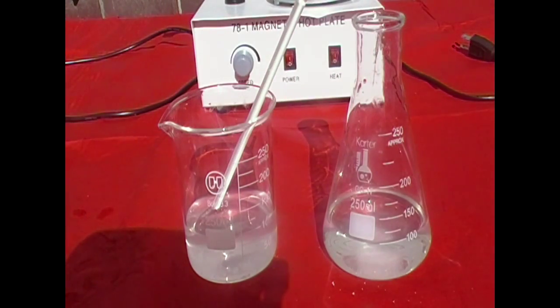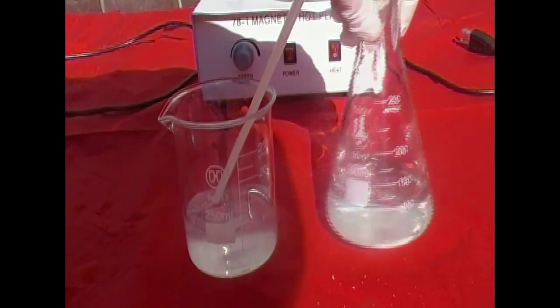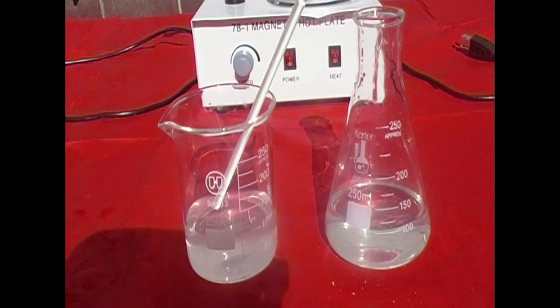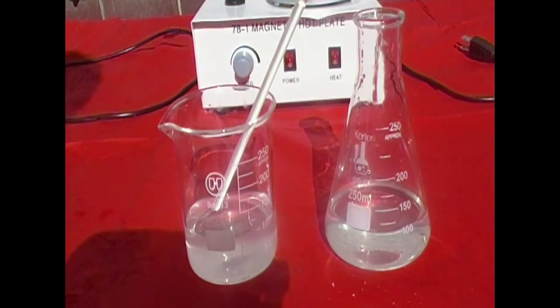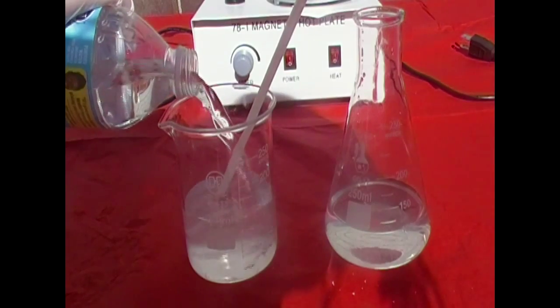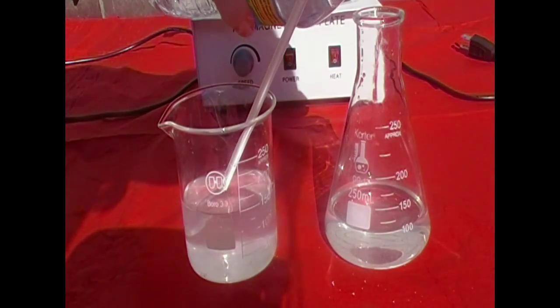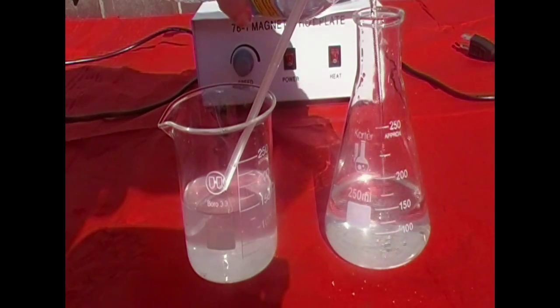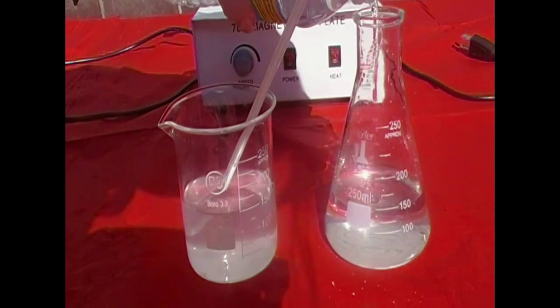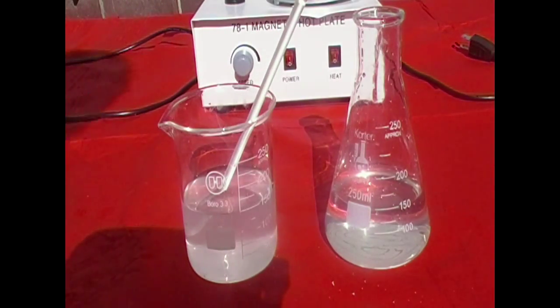In a double displacement reaction, one of the products formed is a type of solid, insoluble material known as a precipitate. The lead 2 iodide formed does not dissolve in water. Therefore, it forms as a bright yellow precipitate. Now if you're afraid you'll miss this reaction, trust me, you're not going to, because the color is way too bright, and it's just so amazing that you'll honestly just be surprised when you see it.